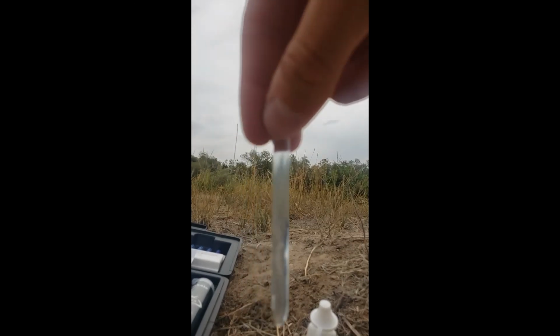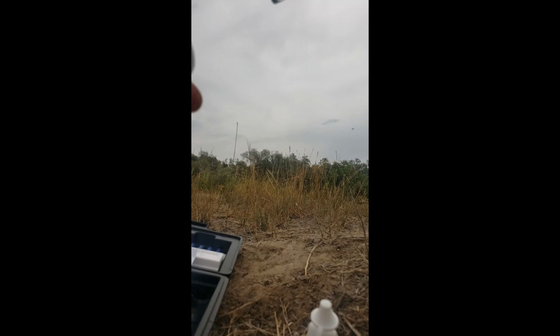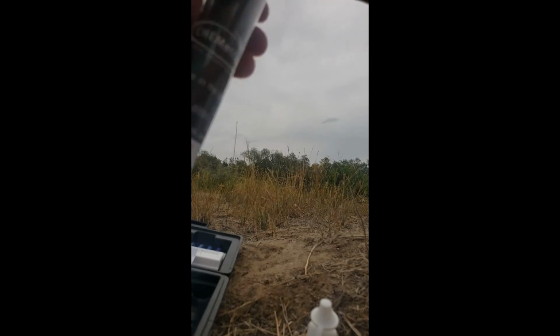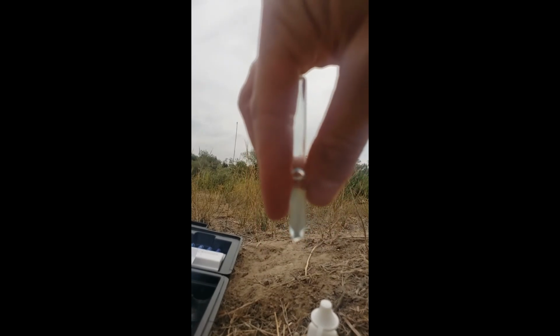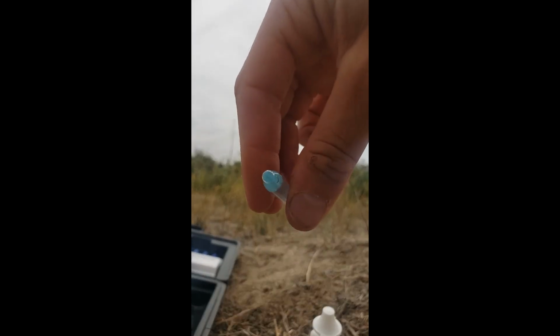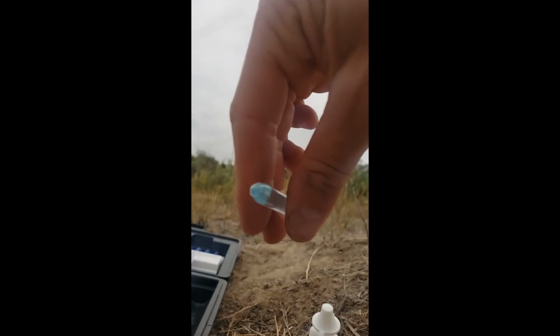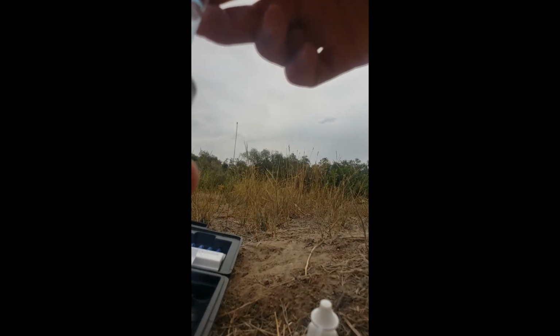Alright, you can still see this? Yes. And I'm going to put it in here, pop this lid off. Oh nope, I'm just going to put it in. Put it in like that. So the surface tension keeps the water from escaping. Those water molecules like to hold on to themselves better than they hold on to the surface of this glass so that they don't fall out.